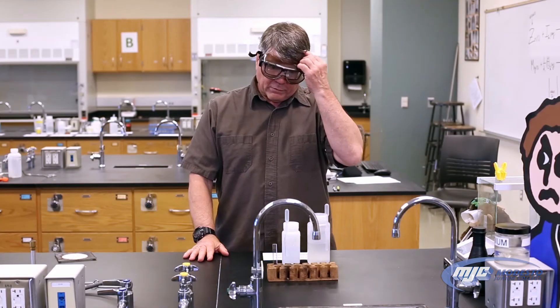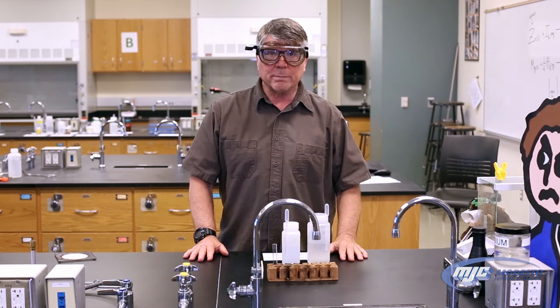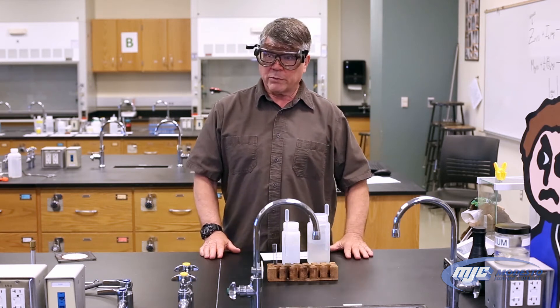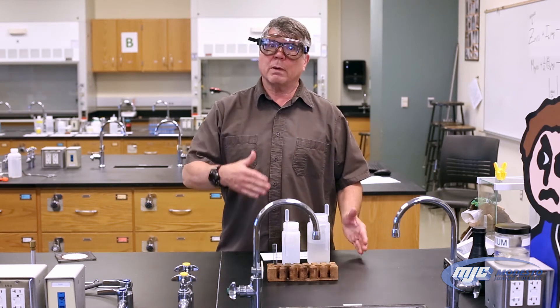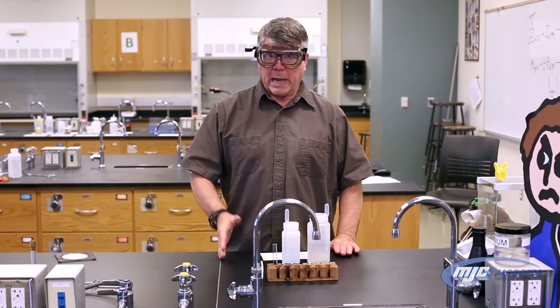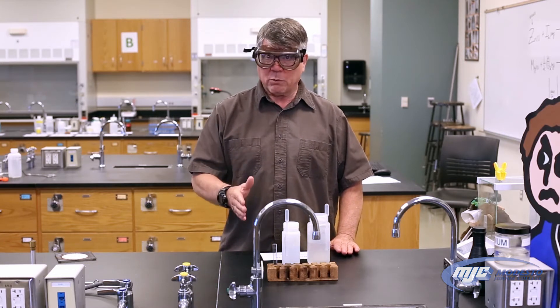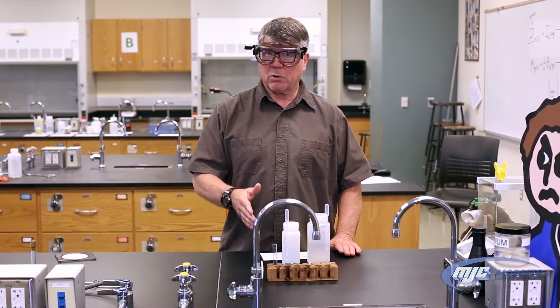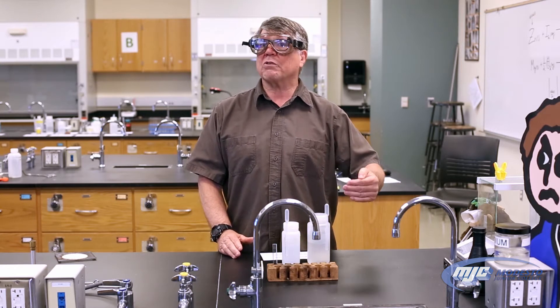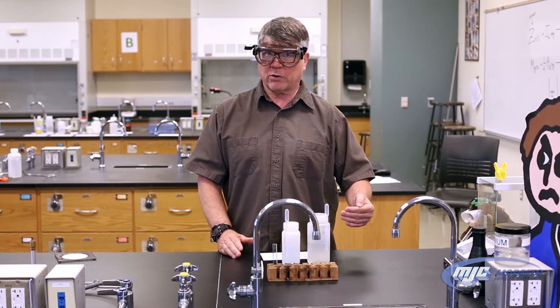This is the chemical reactions experiment. With this experiment, what you're going to do is observe a series of chemical reactions. Every time you observe a chemical reaction, you're looking for one or more signs that a chemical reaction has occurred.